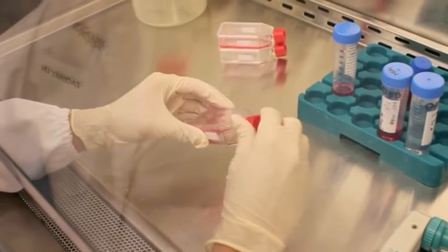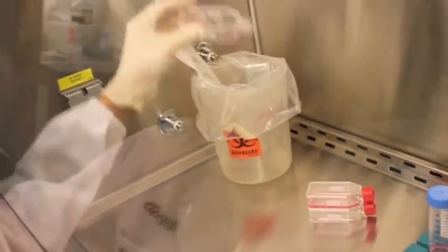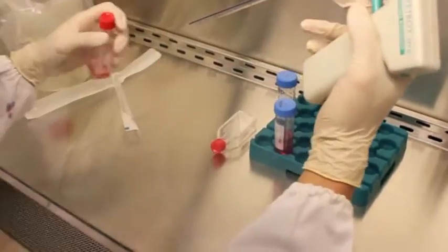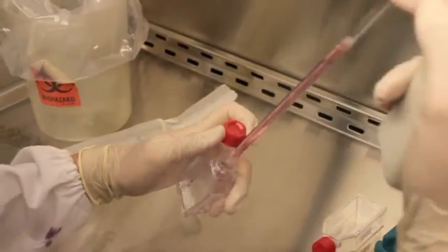Moving on to cell culture. Do not pour away the media directly into the bin. Instead, use a sterile serological pipette along with the pipette boy to remove the media into a waste container.